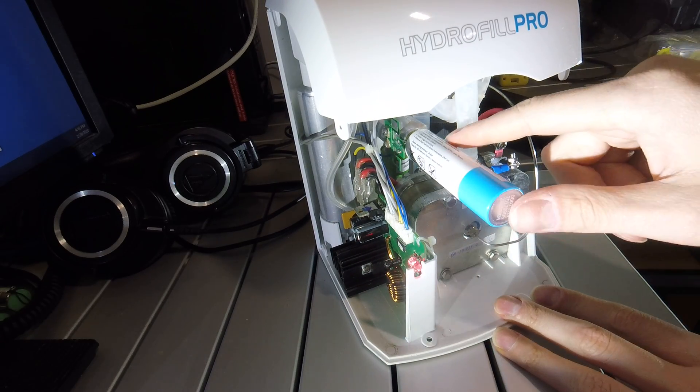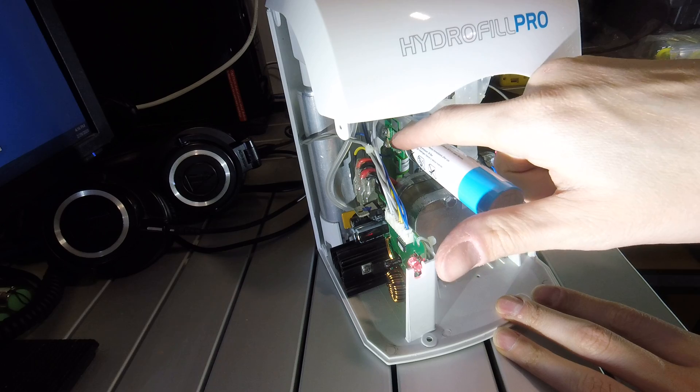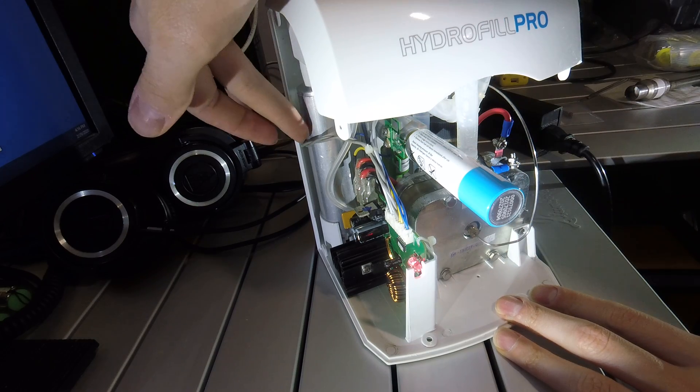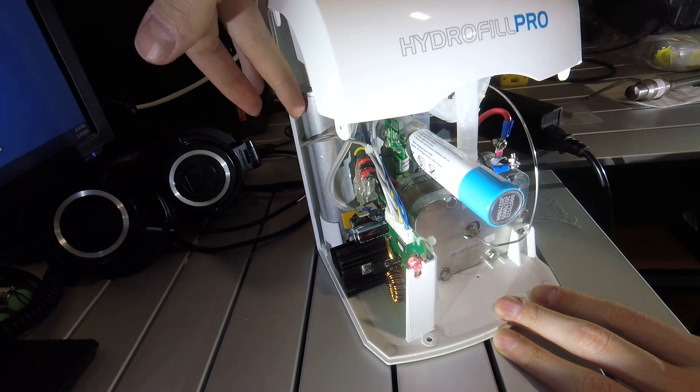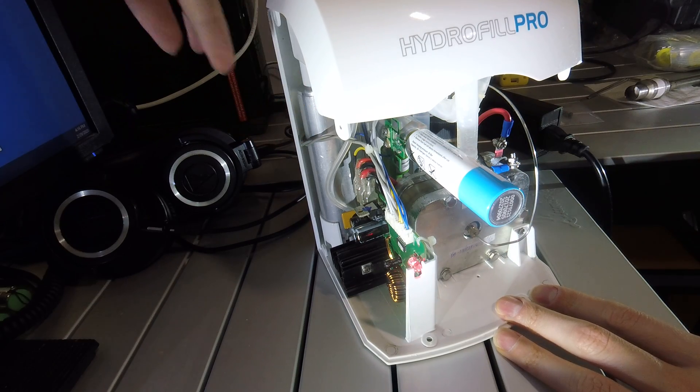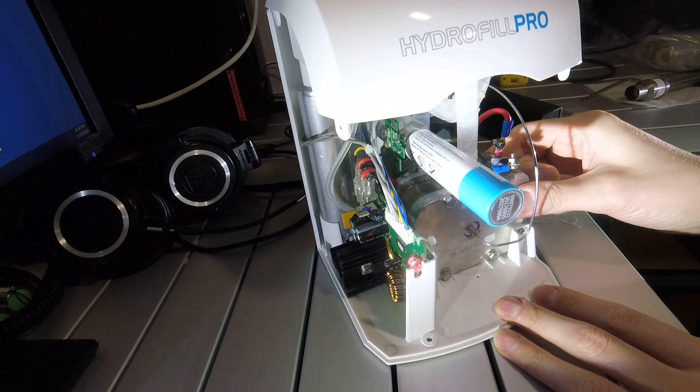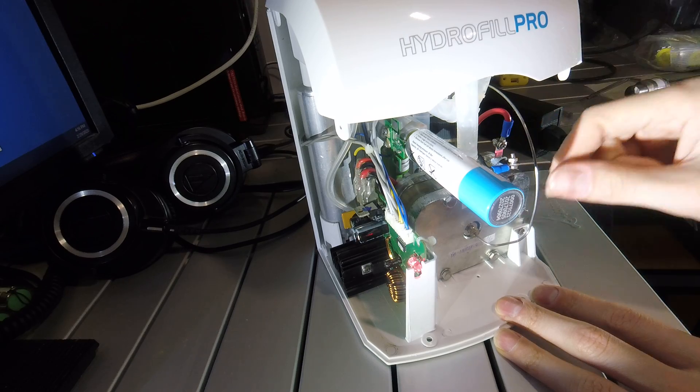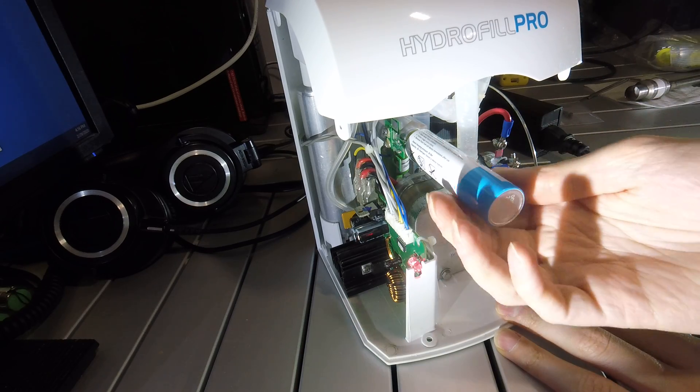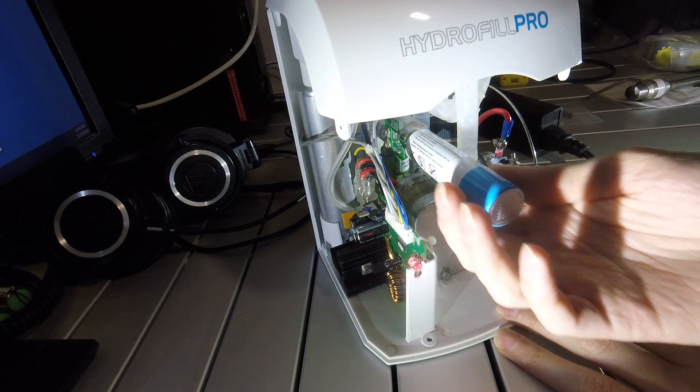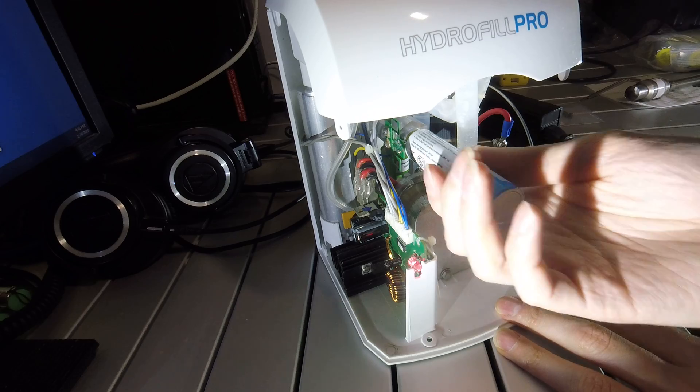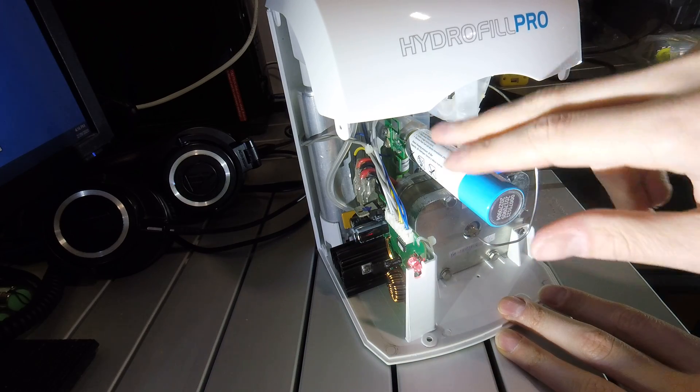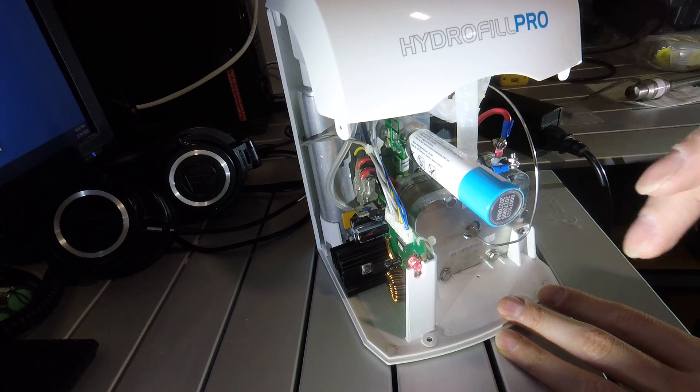It seems to be a pretty simple system. Just monitor once the switch is hit, it purges the PSA column, then it turns on the fuel cell and starts generating hydrogen. And that just gets absorbed in the deuterium. And that deuterium just gets absorbed in this cartridge.